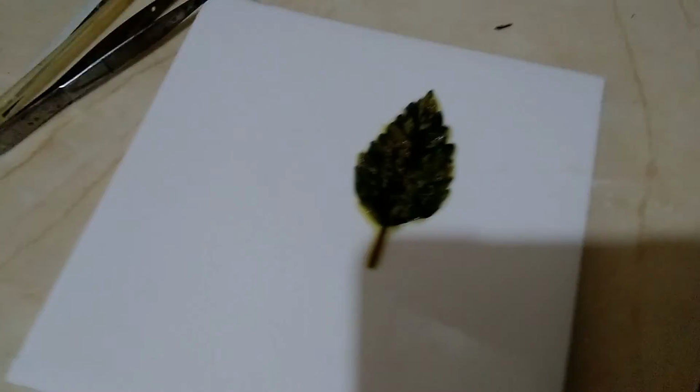Now this is the variegated leaf. My lighting is not so good, but you will observe that you have parts of the leaf that are pretty light in color and parts that are really dark. Now the dark area there, while my camera doesn't give you the best of color, that is the blue-black color.